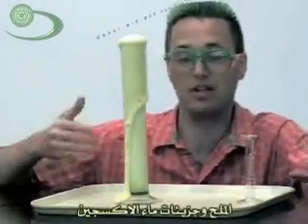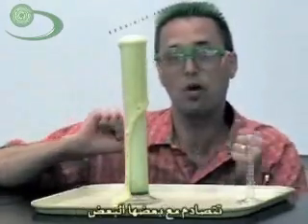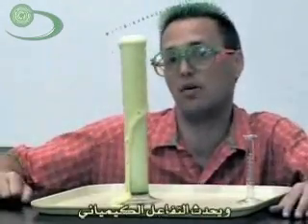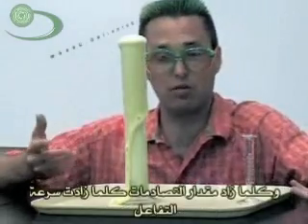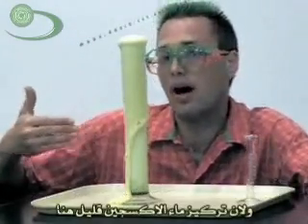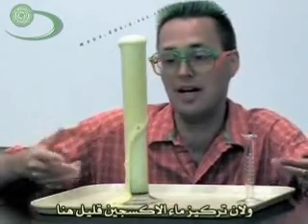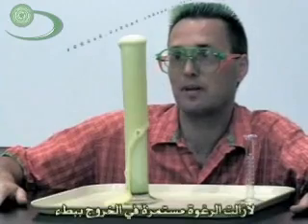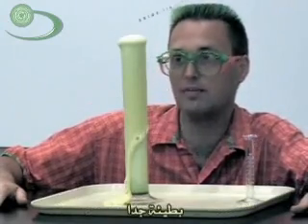So in this case, the salt and the hydrogen peroxide molecules will collide and then you get a reaction. The more likely they are to collide, the faster the reaction will happen. And since we have less concentrated hydrogen peroxide in here right now, it doesn't happen very fast — it's still moving very slowly.